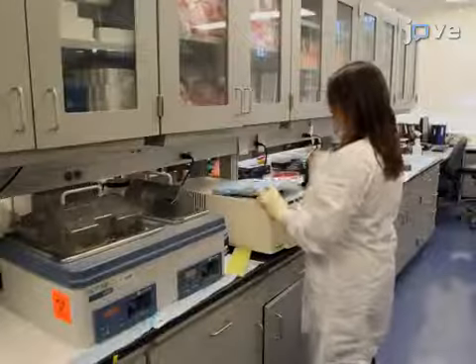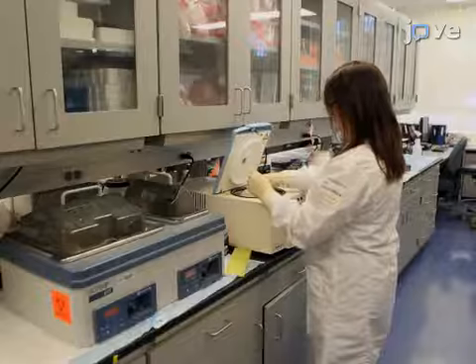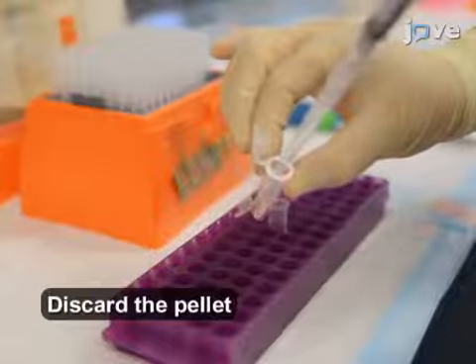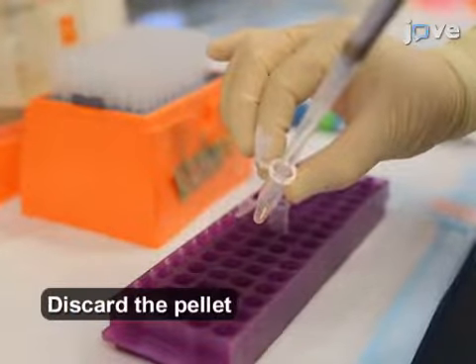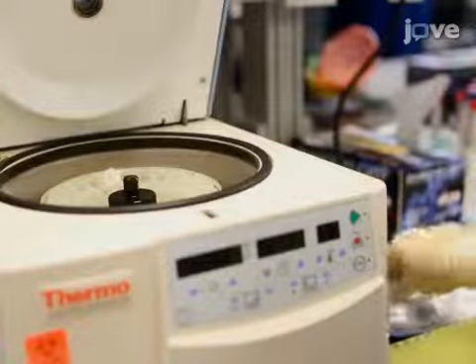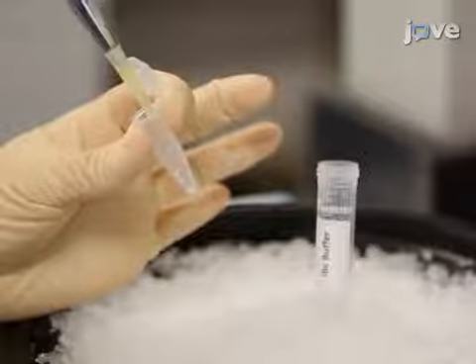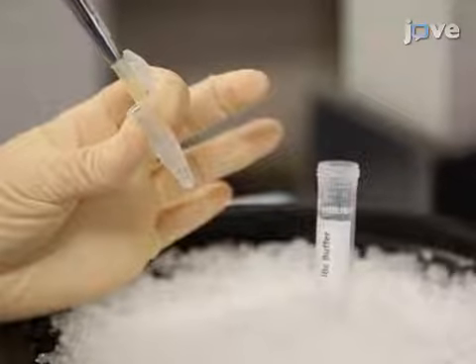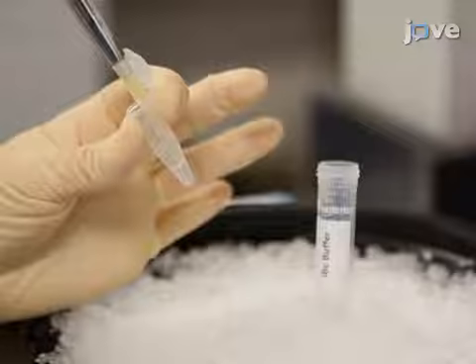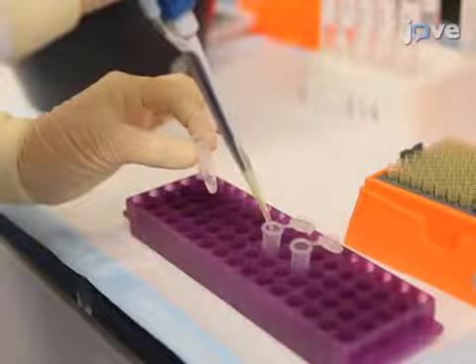After culturing, homogenizing, and pelleting cells according to the text protocol, transfer the supernatant into a new tube and centrifuge the sample at 7,000 g and 4 degrees Celsius for 10 minutes. Then use 200 microliters of ice-cold IBC buffer to resuspend the pellet and divide the homogenate into 2 aliquots.